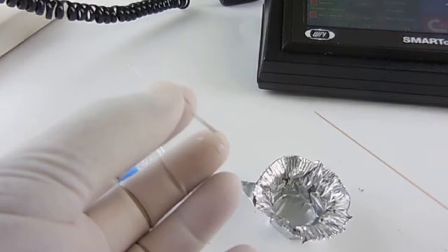The term backfilling refers to the process of filling the pipette from the large, non-pulled end. Backfilling offers a great advantage when performing a bulk fill because the large opening allows you to use a syringe microfill flexible needle.